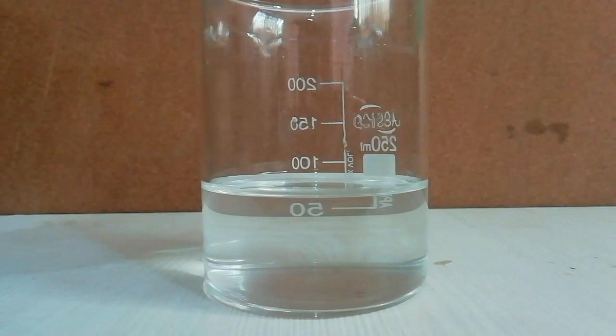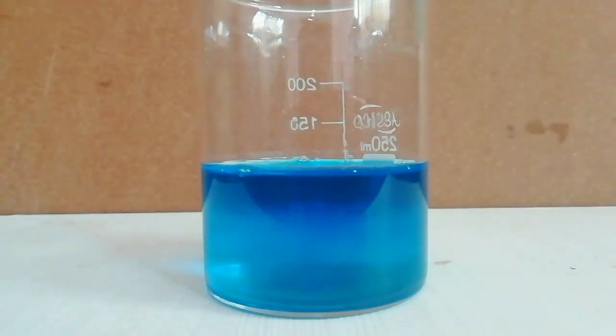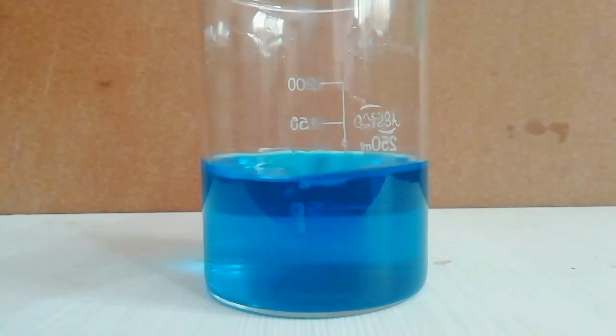Now mix the two solutions together. If the solution is not clear, then filter it once.